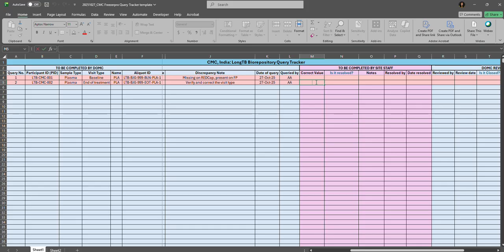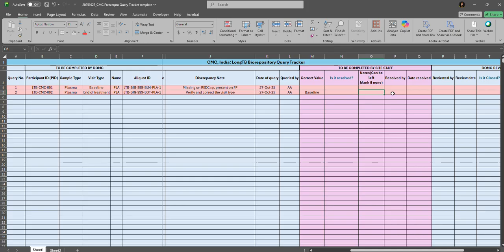Suppose they have corrected the visit type from end of treatment to baseline, and they will enter that corrected value here. Add notes if there are any, like why it was entered as end of treatment before, or why they've changed it to baseline. Or you can also leave it blank if there are no comments. Then respond to this query as yes, since you have corrected it, and add the initials of the site staff who resolved the query, and the date it was resolved.